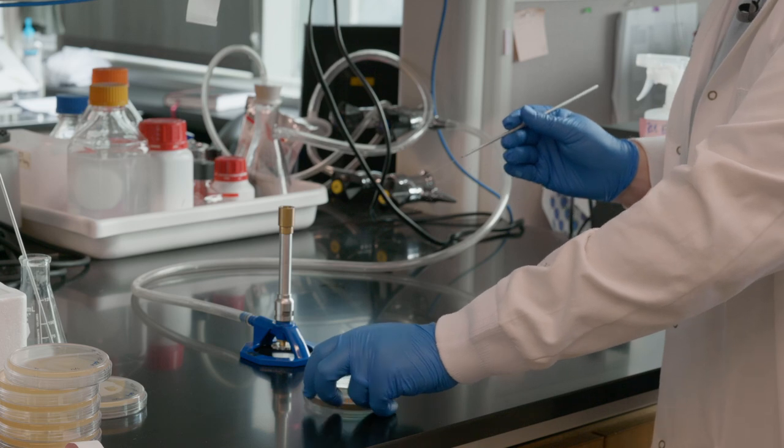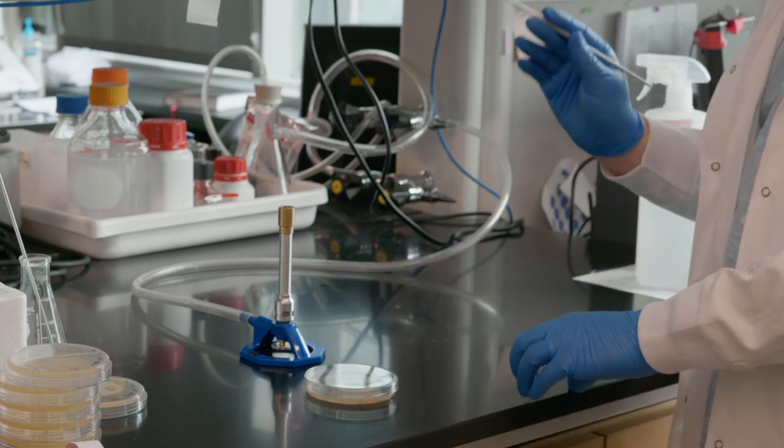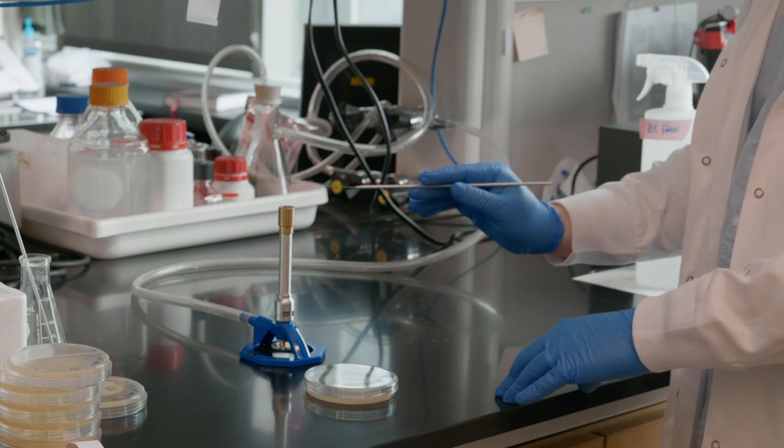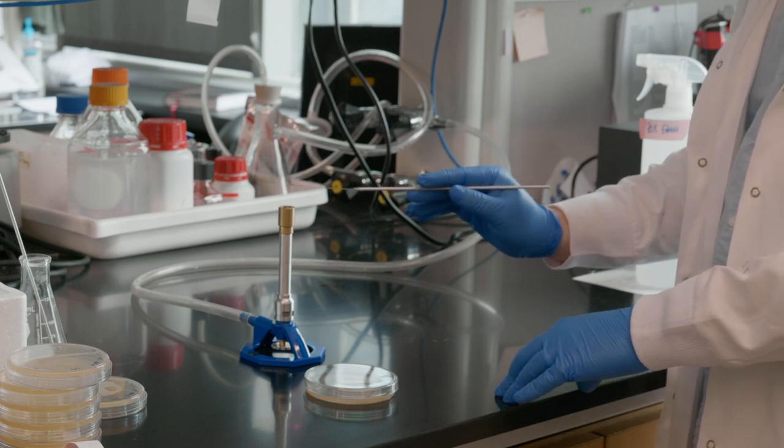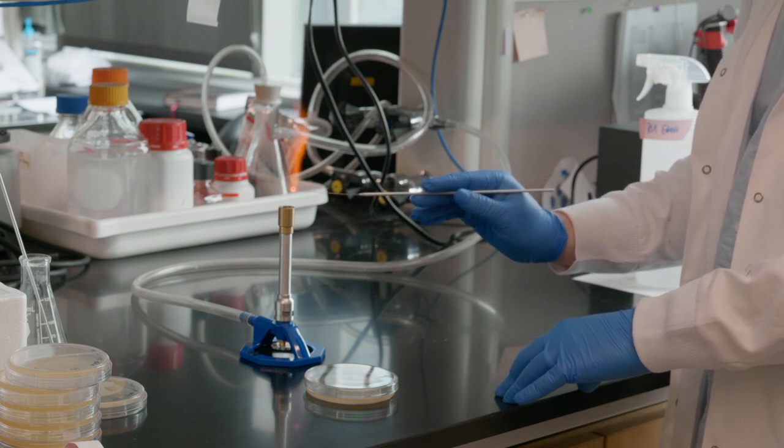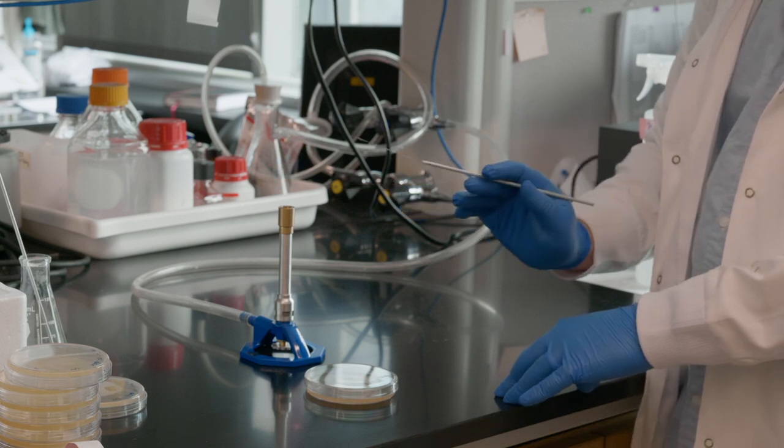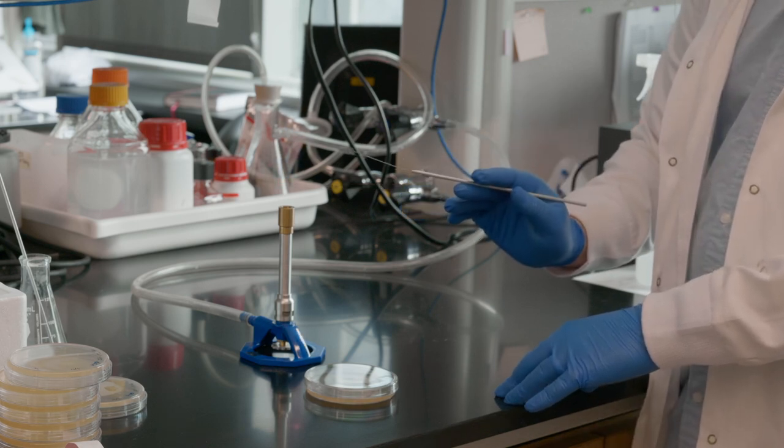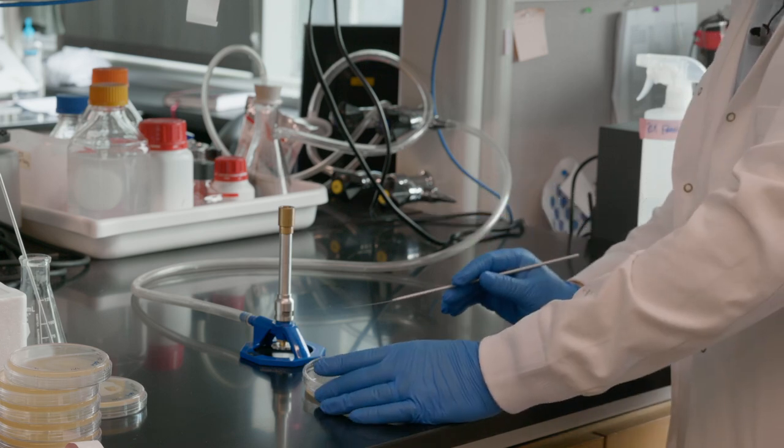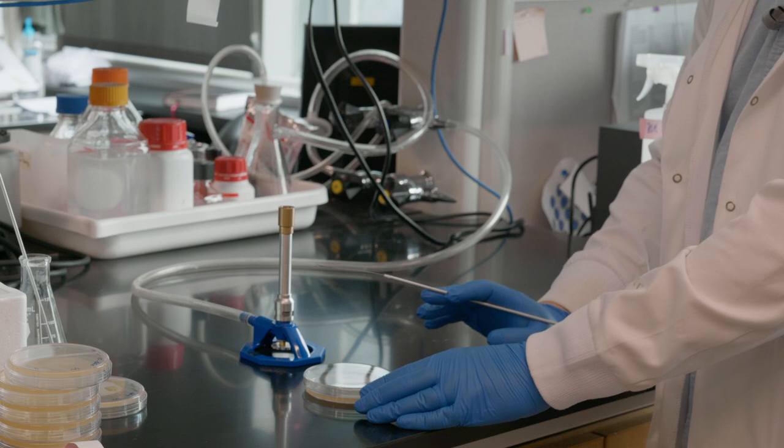So to start, we're going to assume this is all sterile, but this is not sterile. And the easiest way to sterilize this is the secondary function of the Bunsen burner, which is to heat it up. You're going to want it to turn red hot like this, kill off anything that was just sort of lingering on there. Now we'll wait a few seconds for it to cool down, and just for good measure, touch it to the gel.